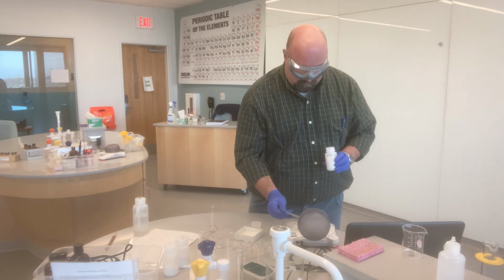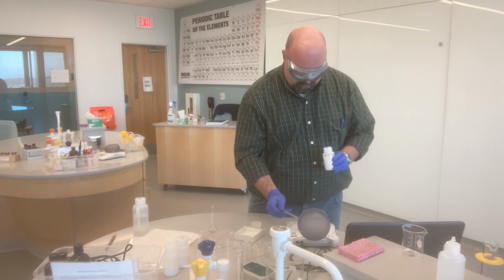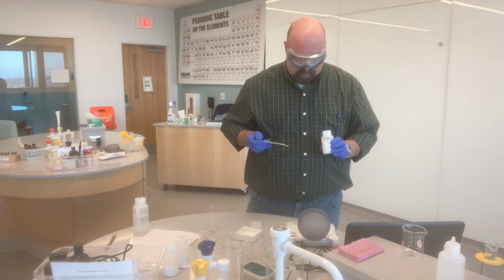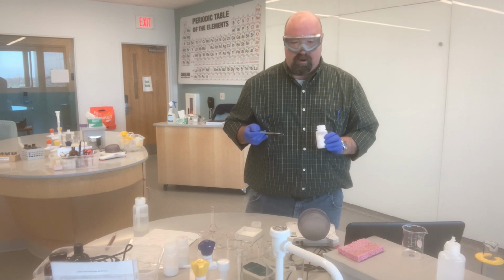So I'm just going to tap it fairly carefully. .070, pretty darn close.